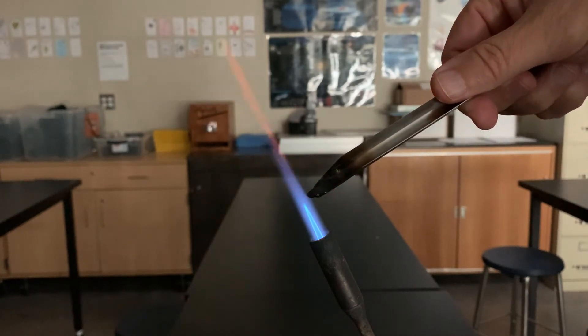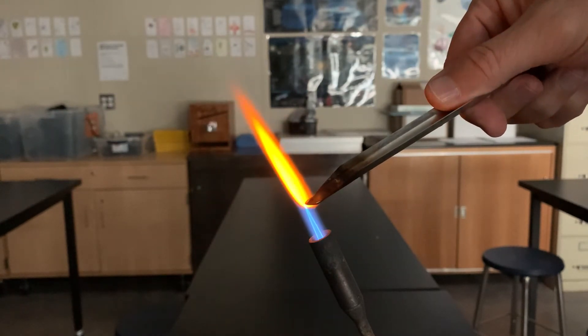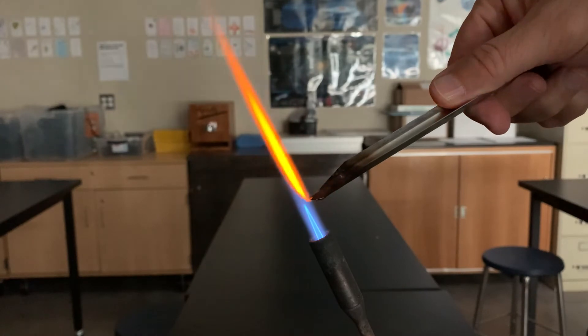There it is. Notice it produces a beautiful orange flame. That's sodium chloride in water.